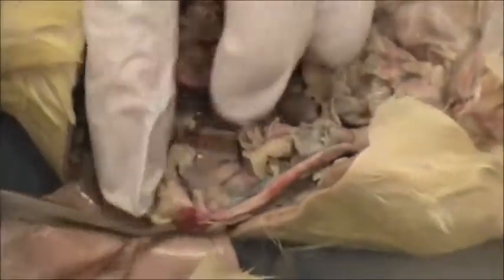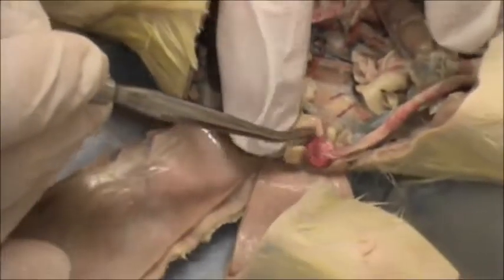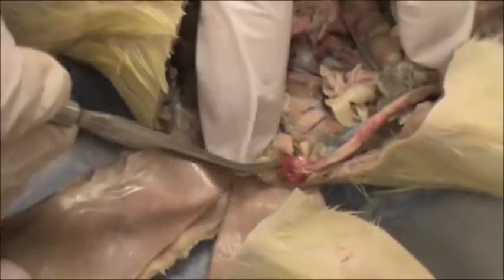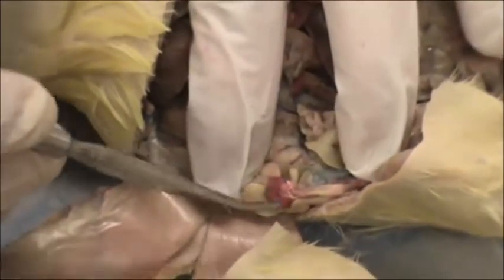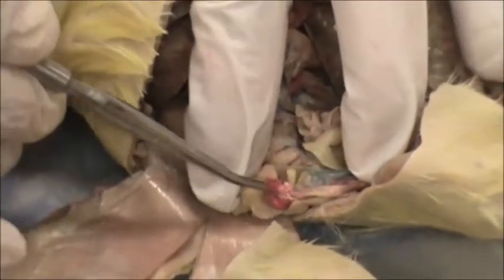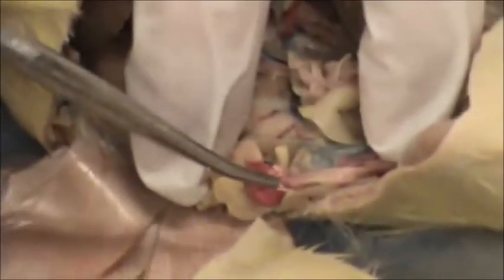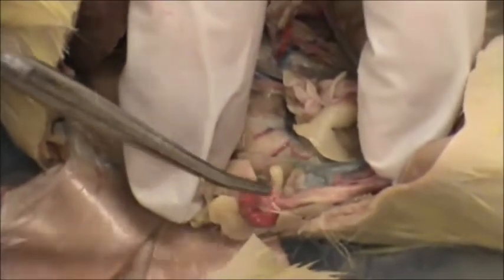At the very end are the ovaries, and they look like dark balls or spheres. In front is this little white snake, and that is the oviduct, which means reproductive tube in the rat — and in humans we call that the fallopian tube.